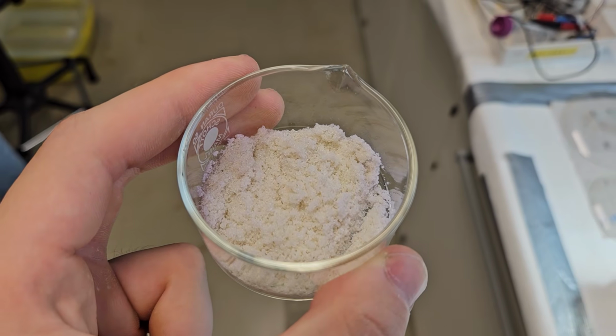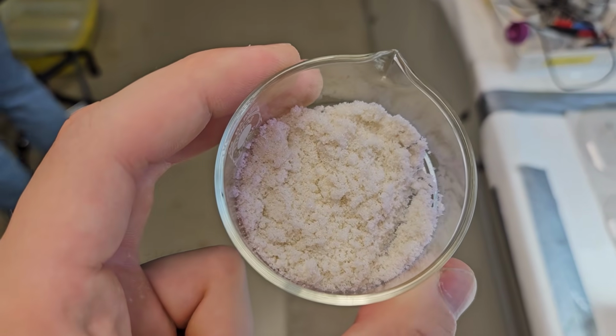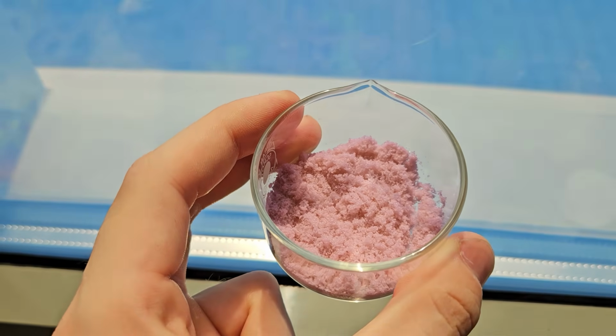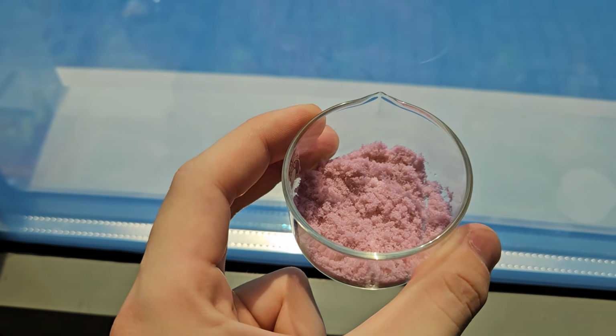Today we will take a look at the Alexandrite effect using very exotic examples. The Alexandrite effect describes a light source dependent color change. This means that depending on the source of the light, our material can change color. And I don't mean that if I shine red light on something it appears a bit more red.